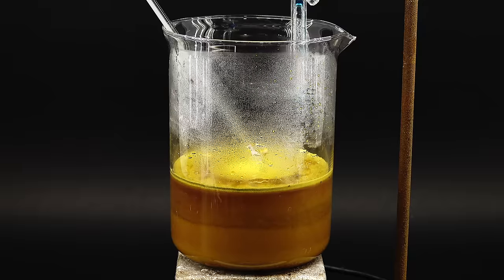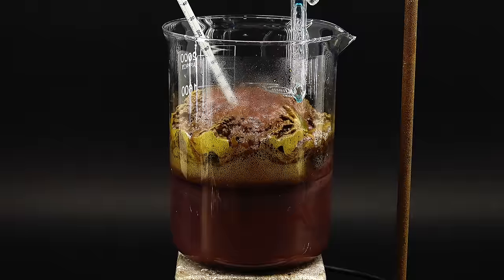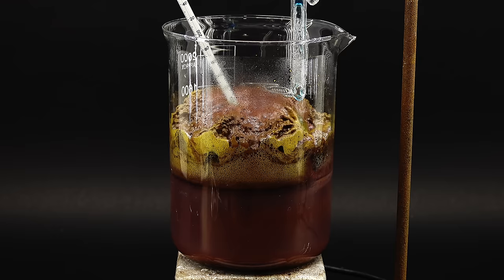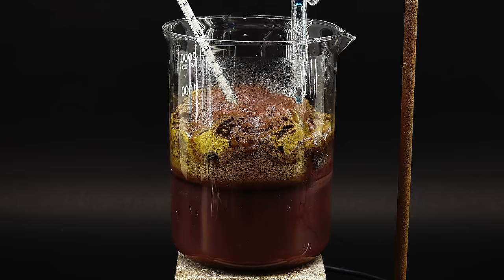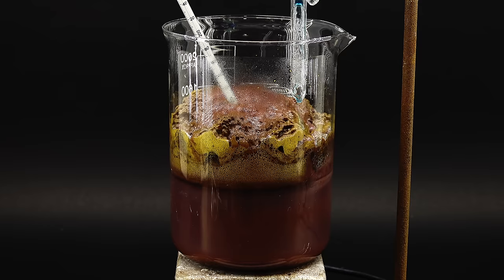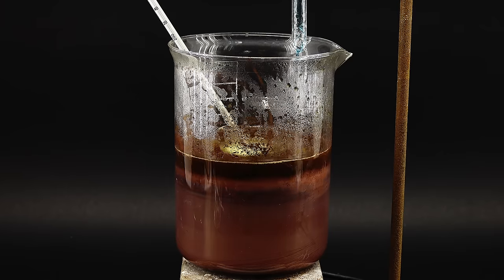Anyway, the previously added gelatin is also quite important, acting as a dispersion agent to make everything run smoothly, however, it also makes this mixture really thick, and causes a ton of this copper foam to appear, which is the sole reason why the copper sulfate has to be added slowly. Anyway, foam aside, the reaction seemed to work quite nicely, and I could actually see some copper depositing on the walls of the beaker, forming this reddish mirror, which was really cool.